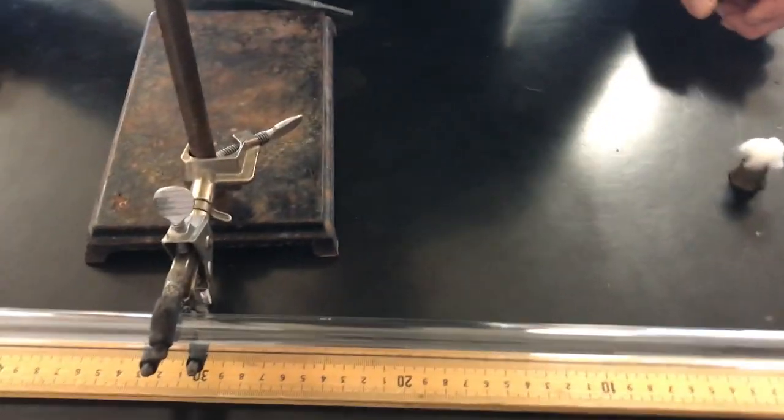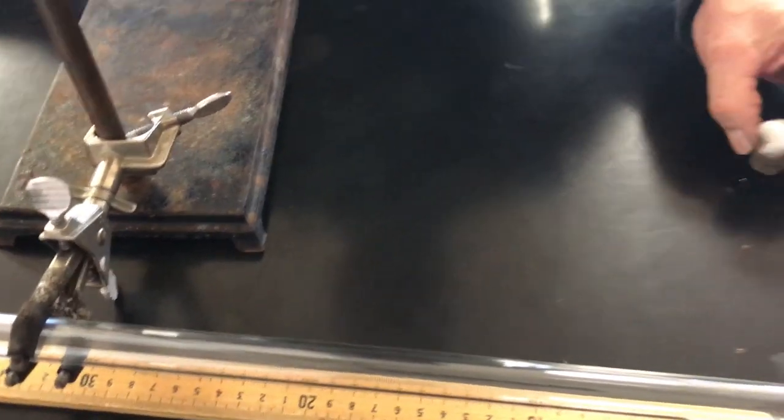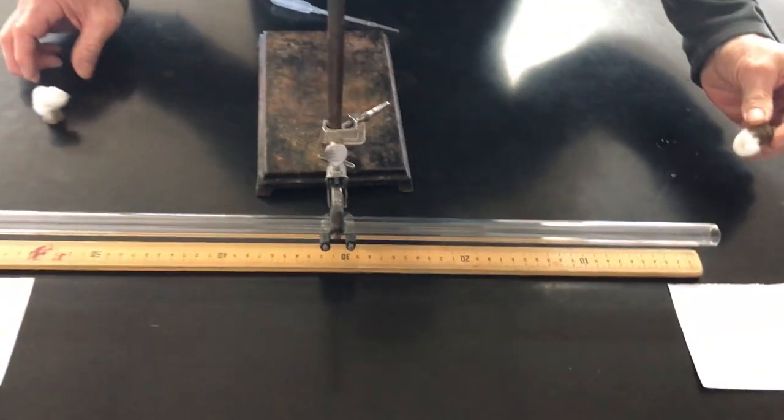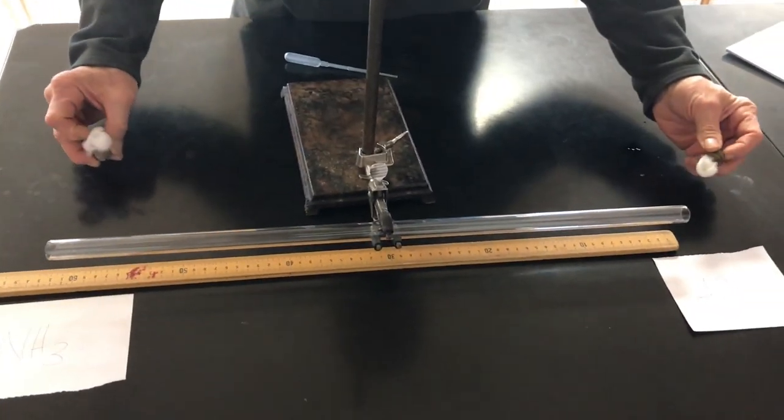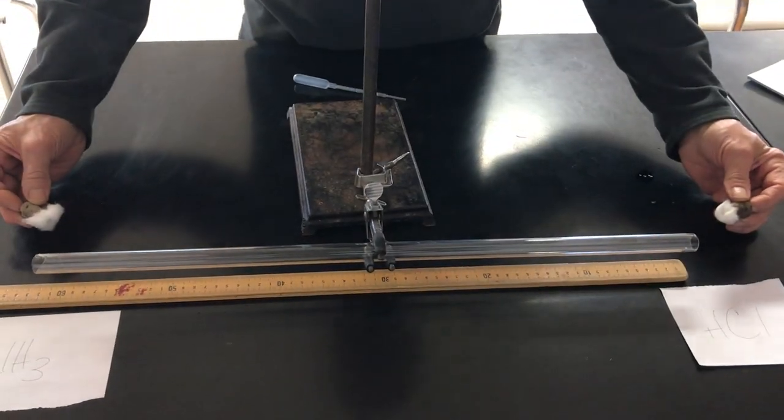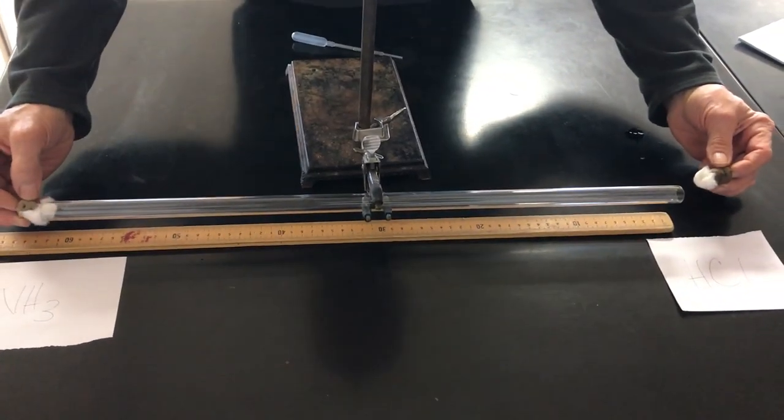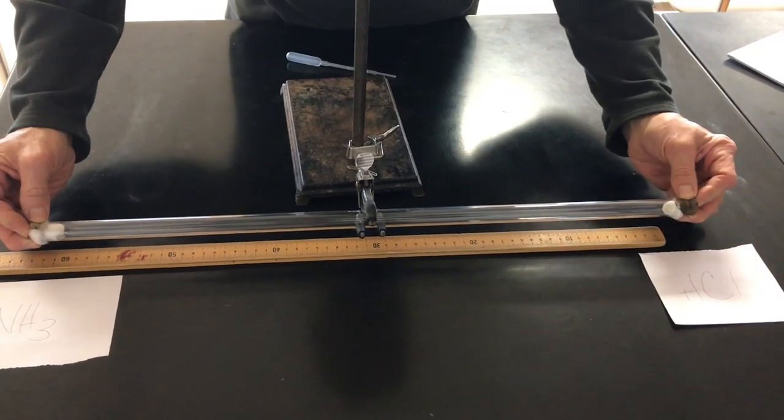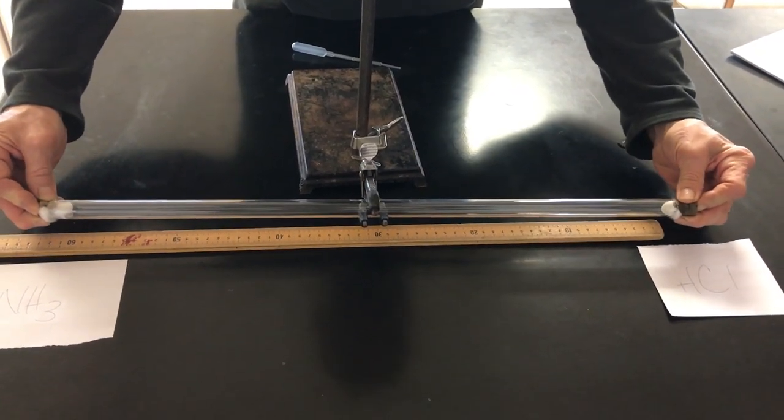And I'm gonna let Mr. Hevel pick this up because this is soaked with concentrated HCl now. He's much tougher than his colleague. I don't care about my skin. Okay Mr. Moore tell me when you're ready. We'll be ready. Students are you ready? Okay here we go. Gas is in.